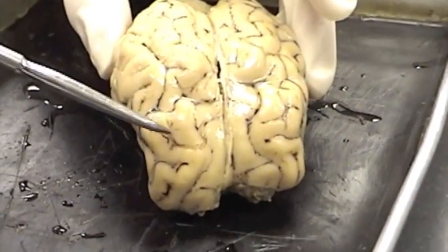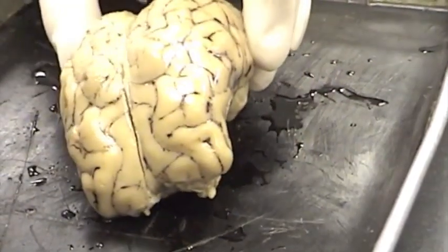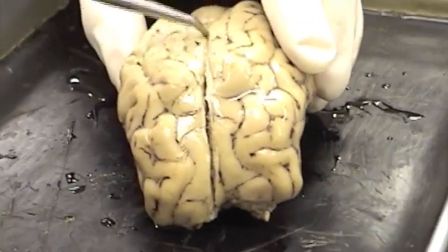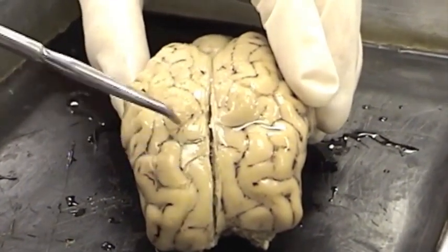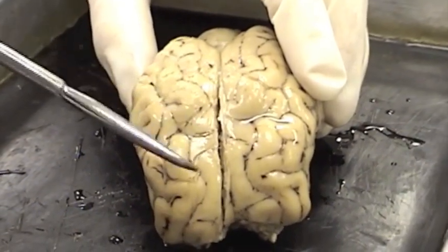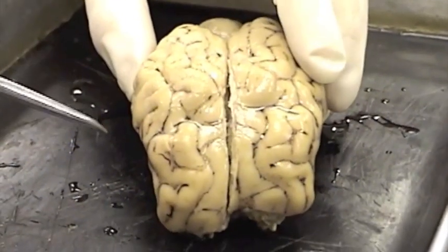The cerebrum can be divided into cerebral hemispheres. Here is the right cerebral hemisphere and here is the left cerebral hemisphere. There is a groove found between the two that is called the longitudinal fissure. A fissure is a deep groove; a more shallow groove we refer to as a sulcus. So here is one cerebral hemisphere and here is another cerebral hemisphere.